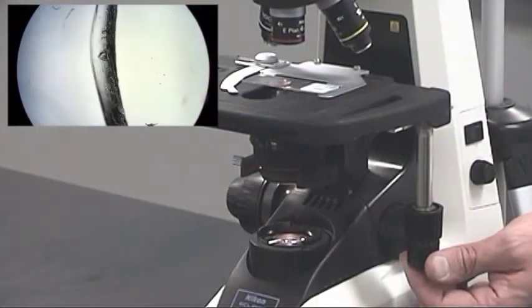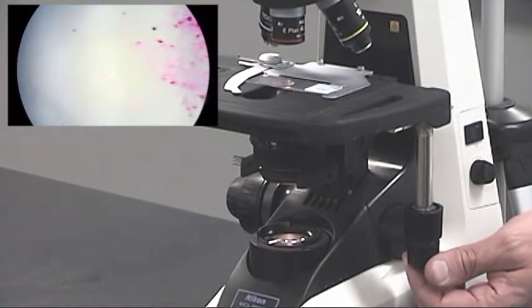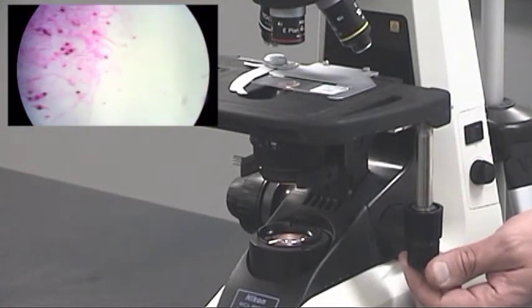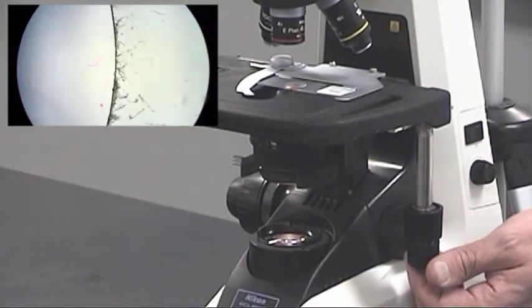When the stage moves in any direction, the image in the eyepiece moves in the opposite direction because the optics invert the image.